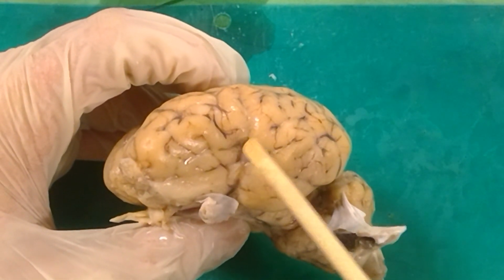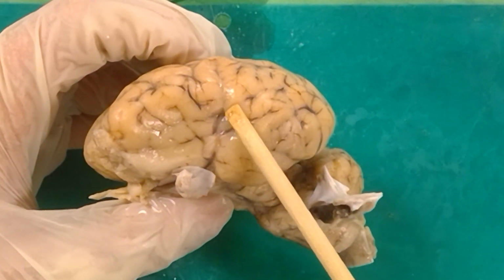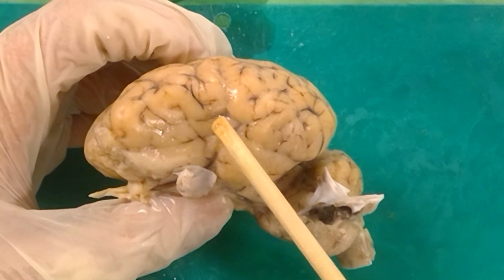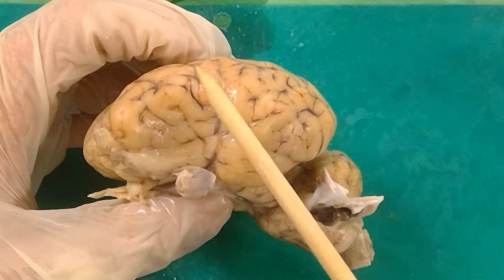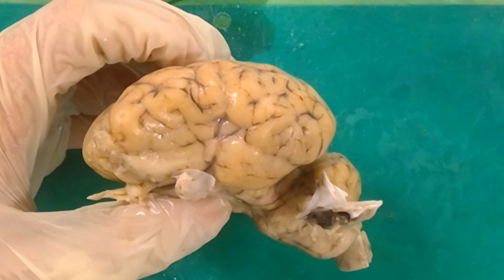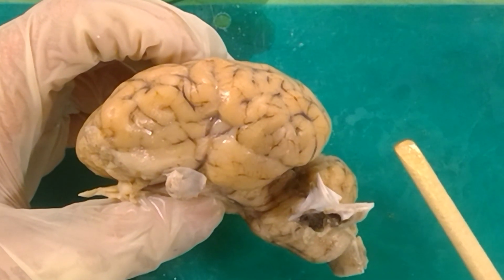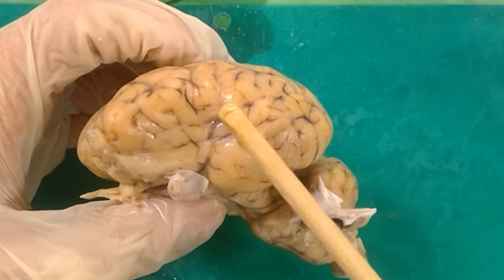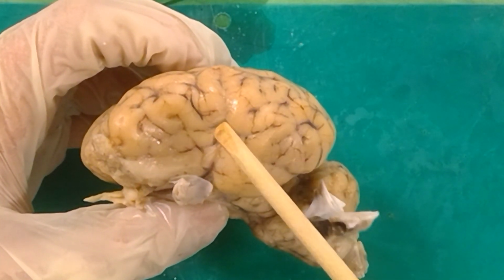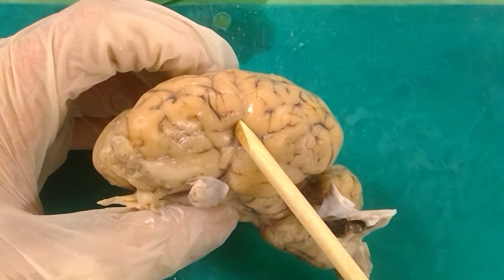This dimple right here is known as the insula, and in Latin that means island. Now in the human brain, evolutionary pressure has caused this part of the cortex to grow over as well as this part to grow over. So the insula really is like an island. If you were to carve away this portion of the cortex in a human brain, you'd find more cortex under there. It's like a Russian nesting doll of cortices. Anyway, on the sheep, it hasn't quite had the same kind of evolutionary pressure, so it shows up more as this dimple in the brain that we call the insula.